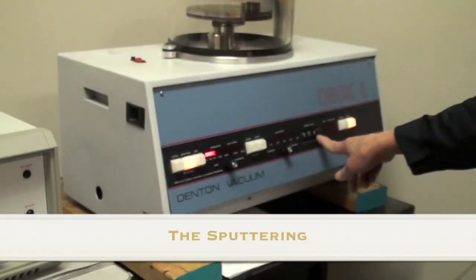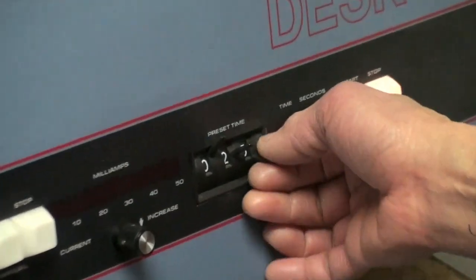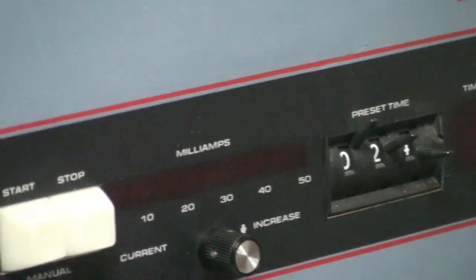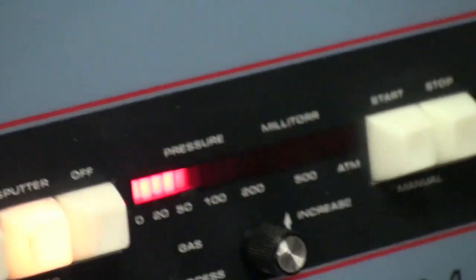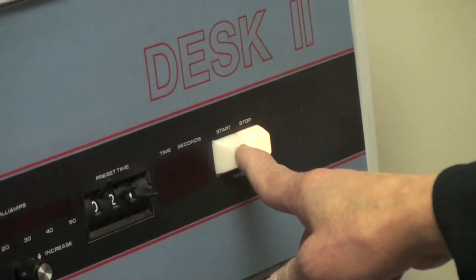So we set up the time here. It's 23 seconds, maybe 25. 25 seconds, 24 seconds. It doesn't matter. The pressure is good. We're ready to go.